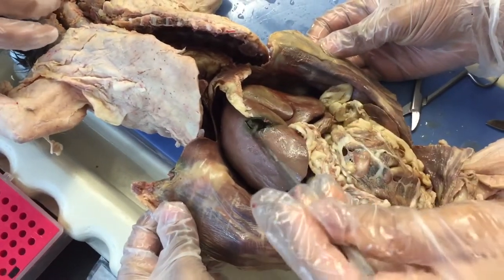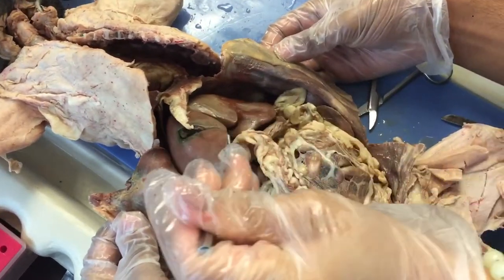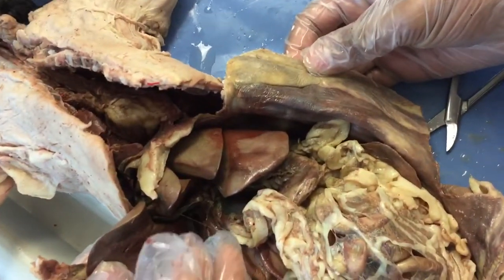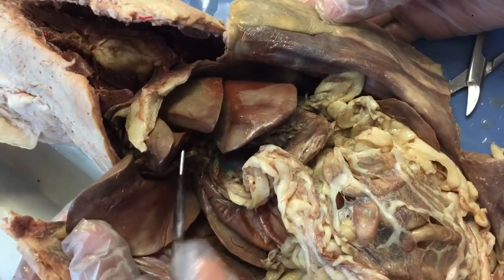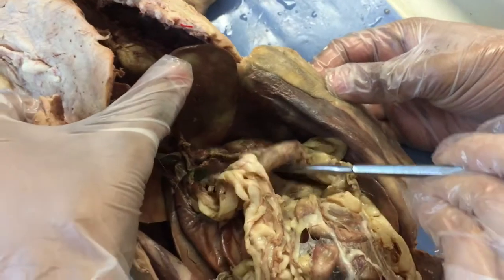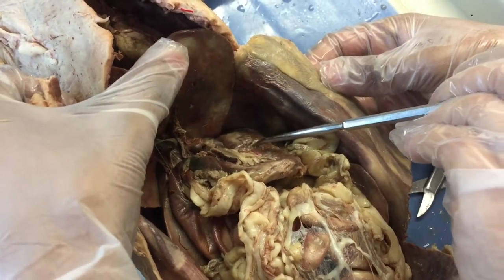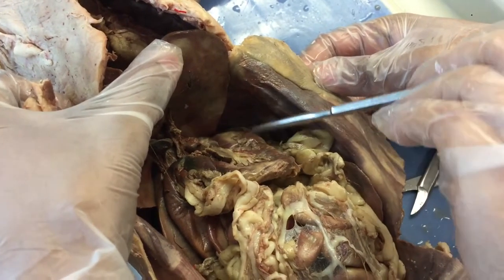Right here, this deflated kind of greenish sac is the gallbladder, and it stores the bile. Underneath that you can see it connects to the gallbladder — that's basically the bile duct. Underneath the liver you see the stomach, which is connected to the esophagus, and it basically digests proteins and lipids.